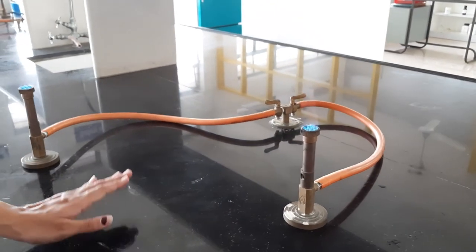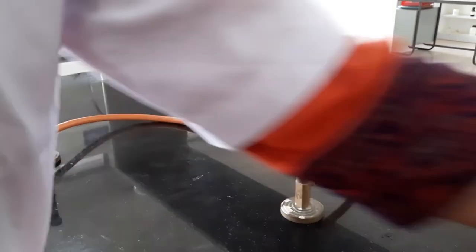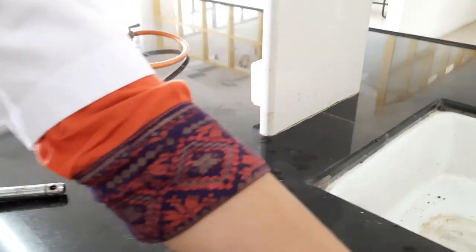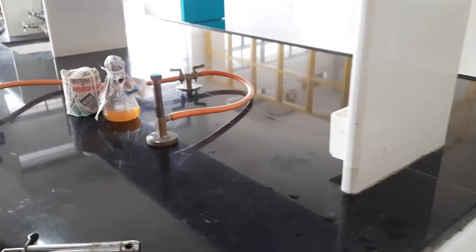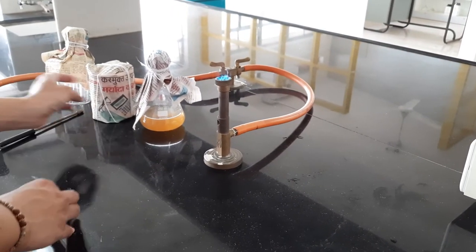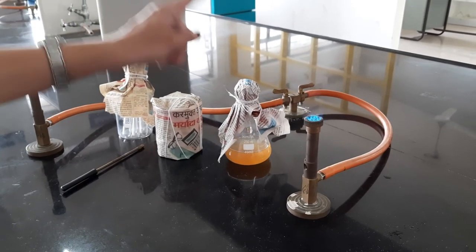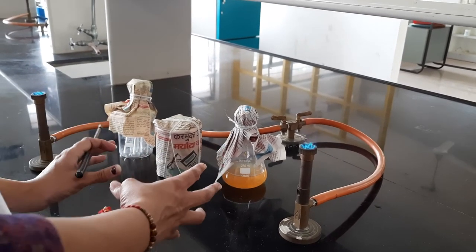I will perform the practical in between these two burners. Whatever requirements I need, I will place in between these two burners so that a completely sterile environment will be maintained, and then I will perform the practical here.